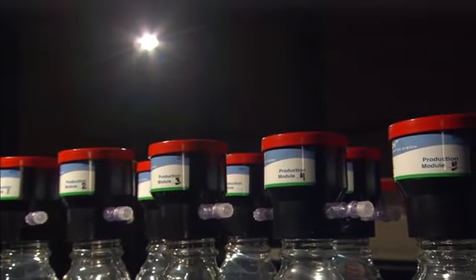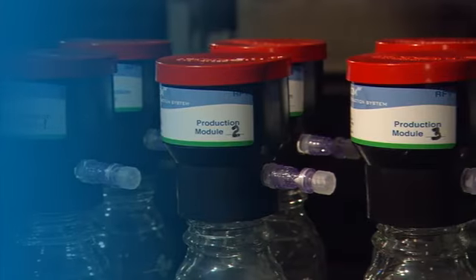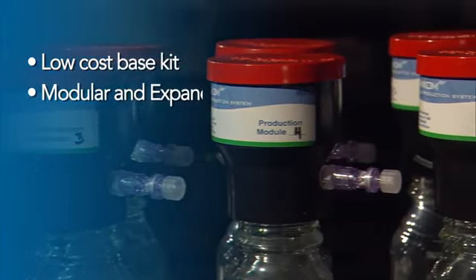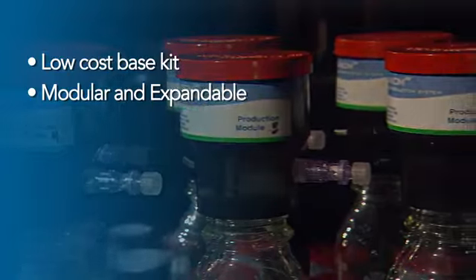Designed for expandability, up to 50 RF1 modules can be used with one base kit. Up to 5 kits can be operated in a single lab. The RF system provides a base kit that includes 5 RF1 modules for a low-cost entry, is modular and expandable, capable of up to 50 RF1 modules on a single base kit.